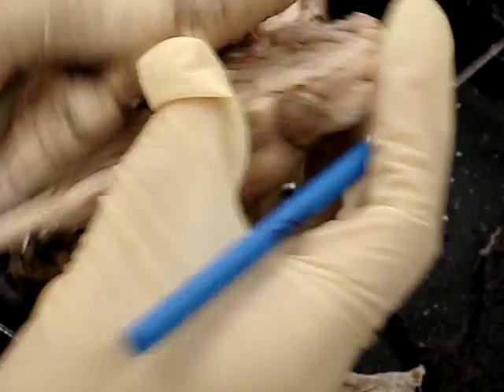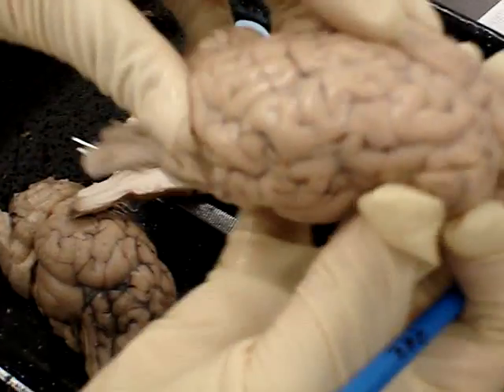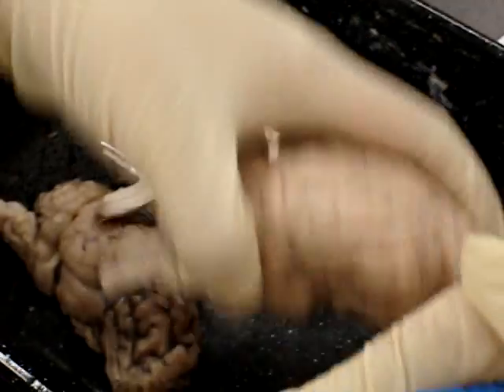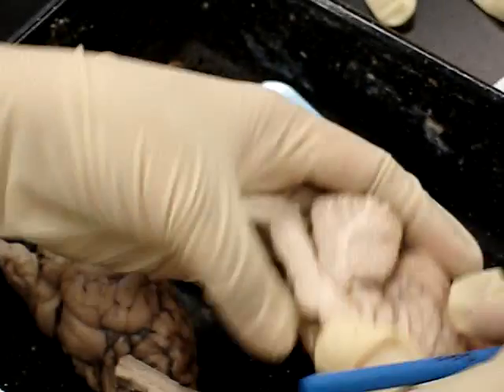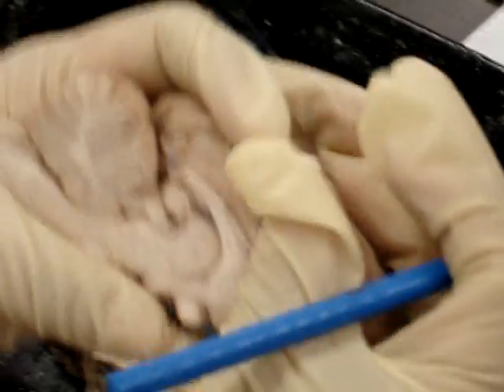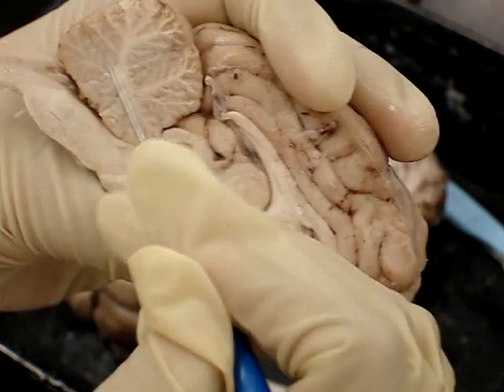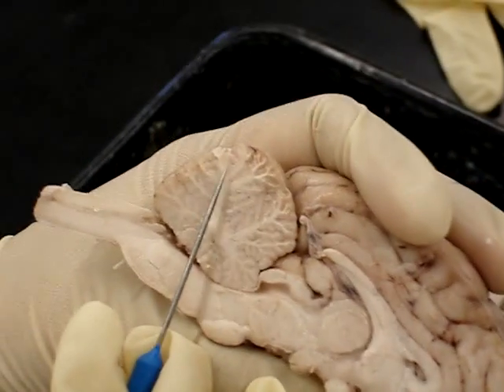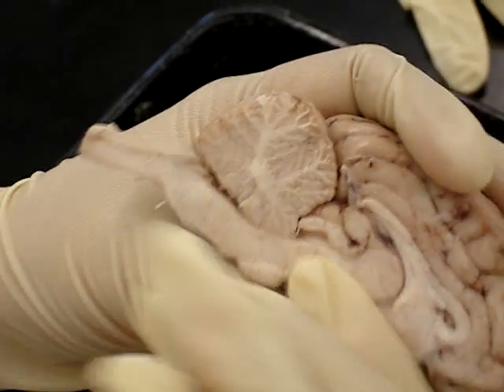Gray matter is basically the outer covering of the brain. If you look at half of a brain, this is actually gray matter. You can tell the color difference — white matter is white, and gray matter is grayish.